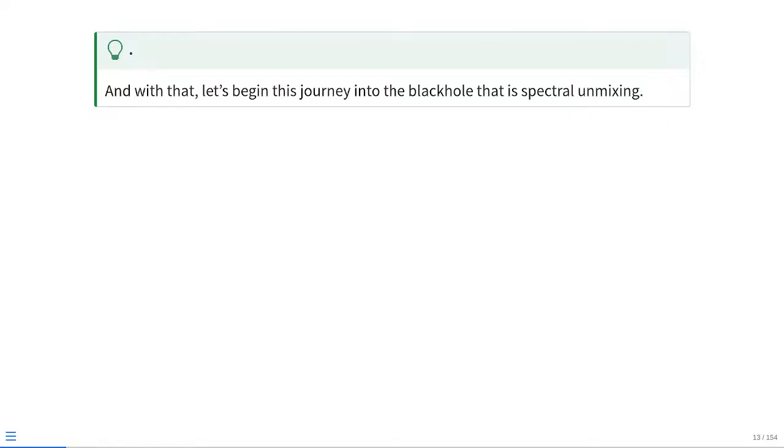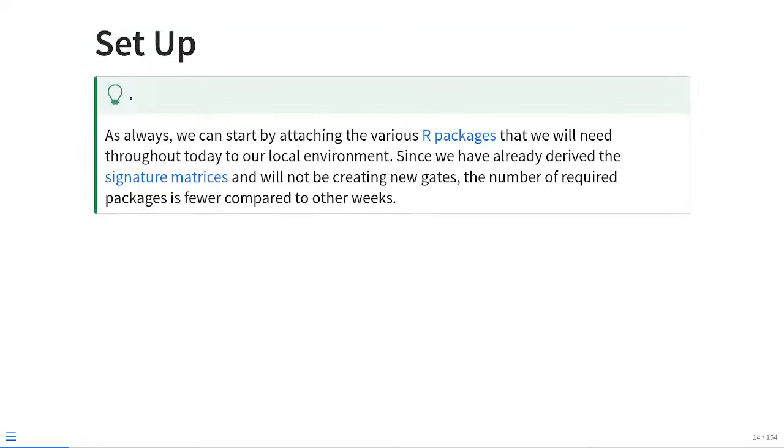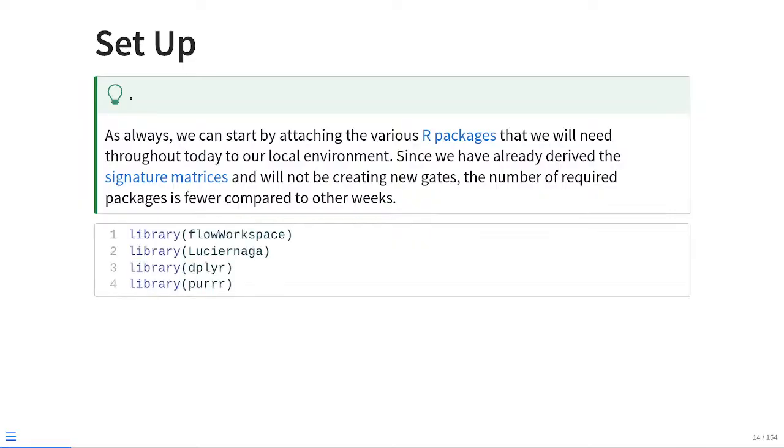And with that, let's begin the journey into the black hole that is spectral unmixing. So, as always, we can start by attaching the various R packages that we will need today to our local environment. Since we have already derived the signature matrices and we're not creating any new gates, the number of required packages will be fewer compared to other weeks. Namely, we just need to load FlowWorkspace, Luciernaga, dplyr, and purrr.